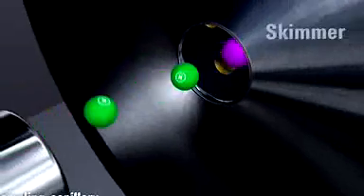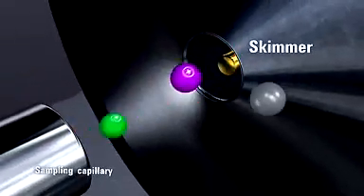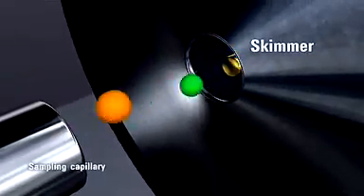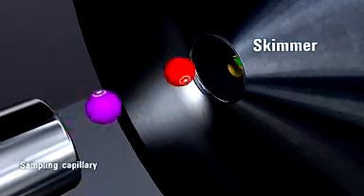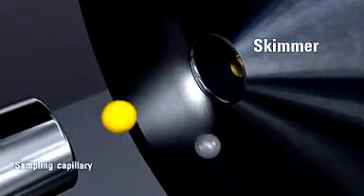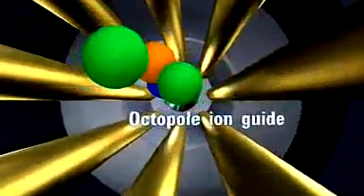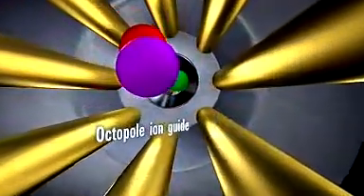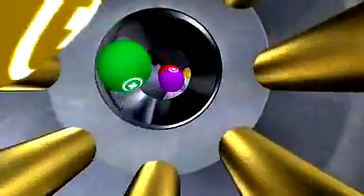A thin skimmer aperture, carefully matched hole size, and short capillary-to-skimmer distance reduce beam broadening. An octopole ion guide provides better ion transmission over a wider mass range.